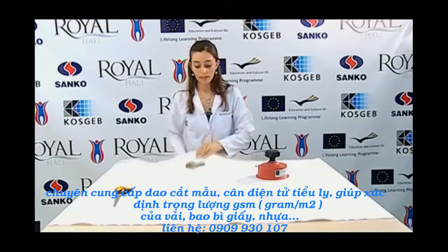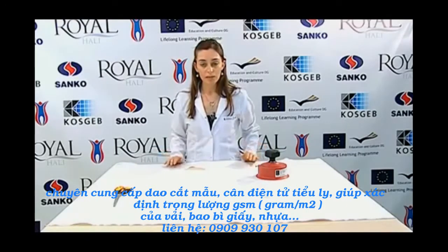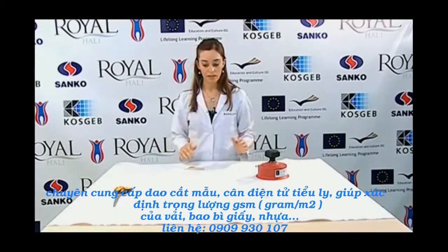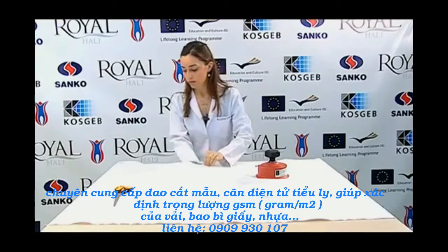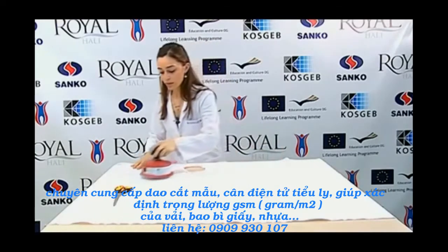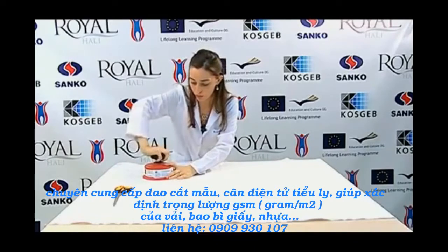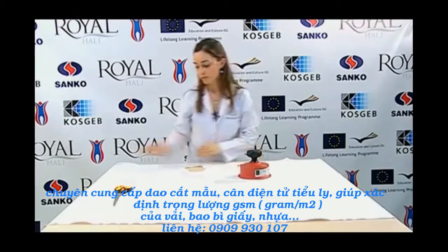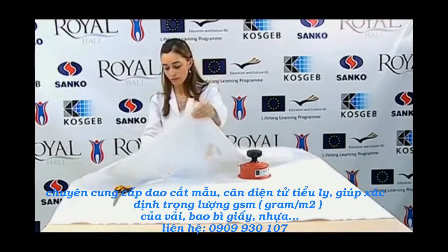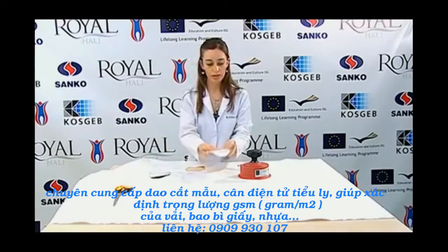At this point, attention should be paid to take the samples from different parts so that the samples can represent the whole fabric. The second sample is cut from a transverse point as it contains different warp and weft yarns. As seen, the second sample is prepared in the same way.